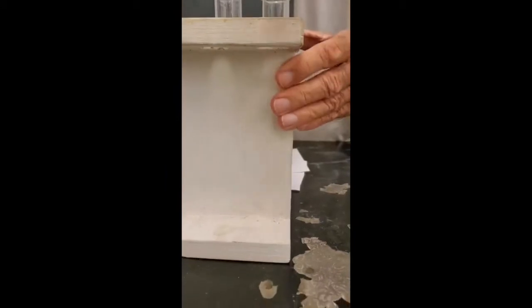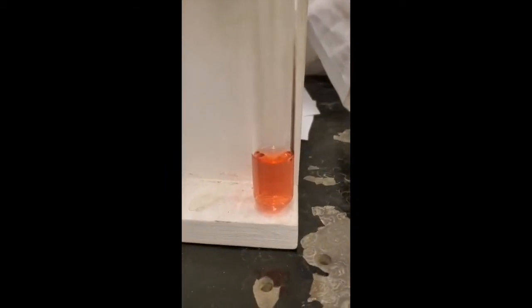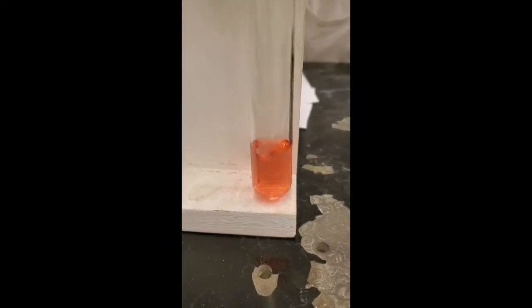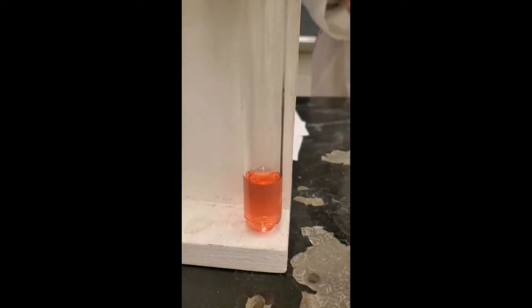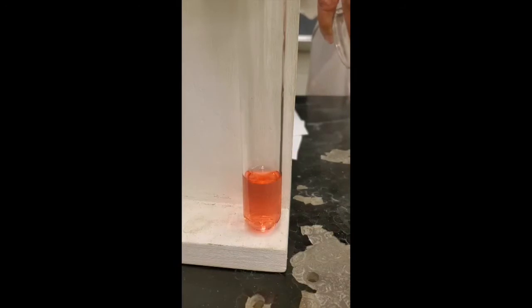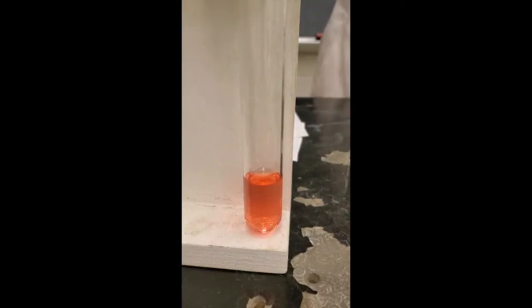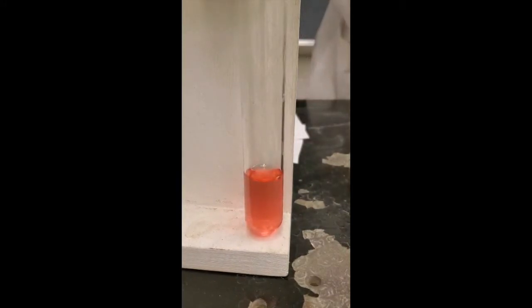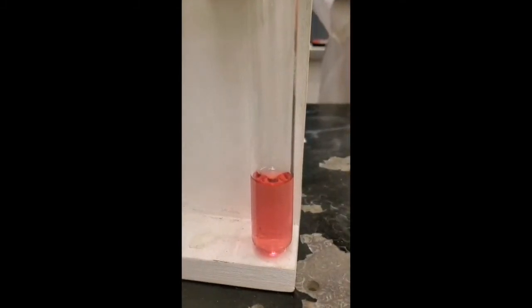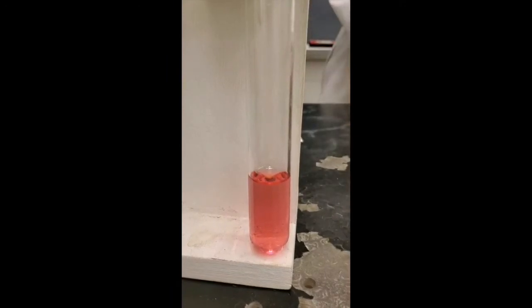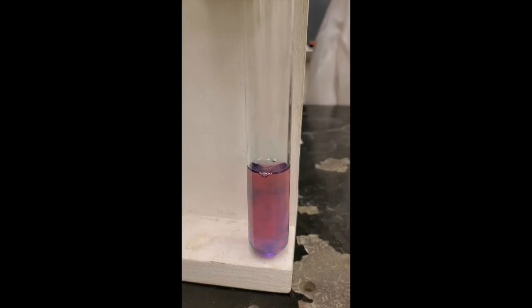See if there's any evidence of reaction. Let me shake it up. Is there any? Doesn't that look a little different? Let's add another one. It's starting to get a little different, isn't it? Let's go add some more. Let me measure these out. Now, let's put two milliliters in this time. You see any evidence of something happening? You did, didn't you? I'll put two milliliters at a time, make it easier and faster. See if you see any evidence. You see any blue developing? I have two more milliliters. See if you see any evidence of blue. It's starting to turn blue.